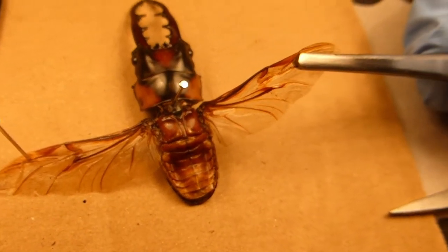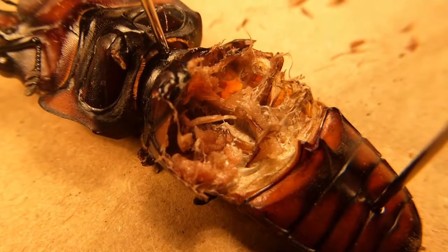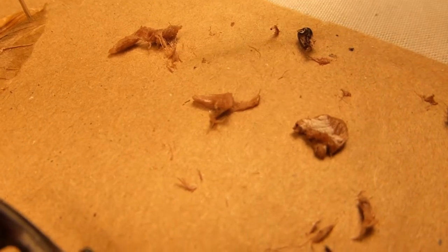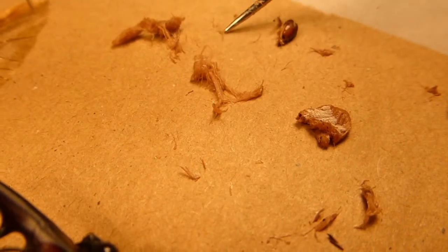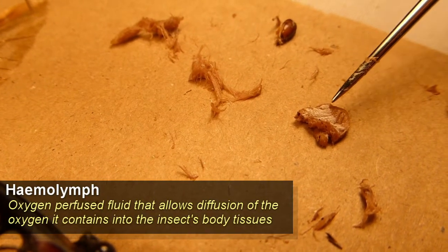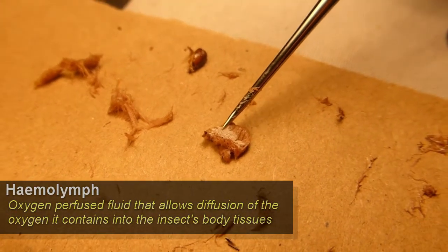You can see this sort of veined texture of the wing here. I've now removed the ventral side of the thorax of this beetle, exposing some of the organs inside. A lot of the stuff around here is the stomach contents — you can see it's sort of wood pulp kind of material. This will also be a mixture of haemolymph, which is the insect equivalent of blood.